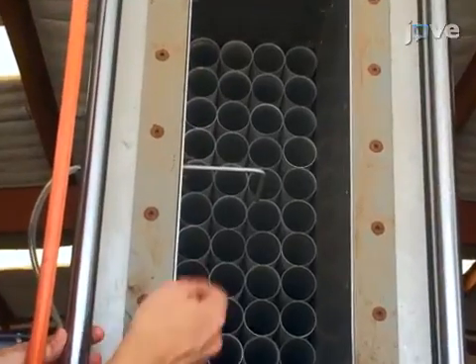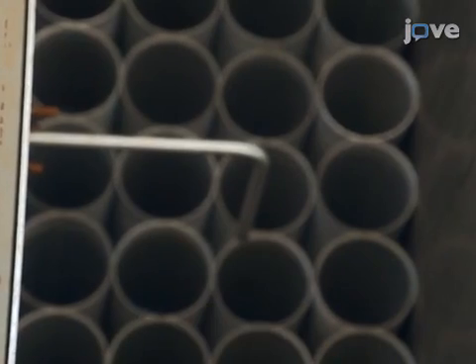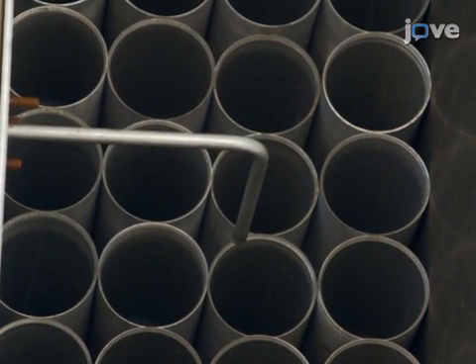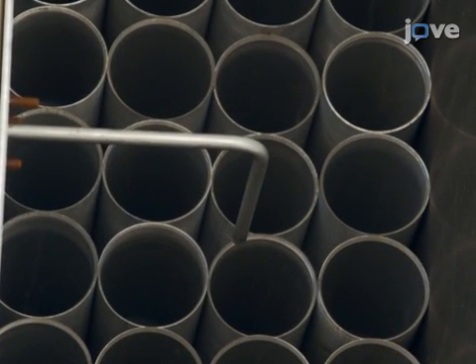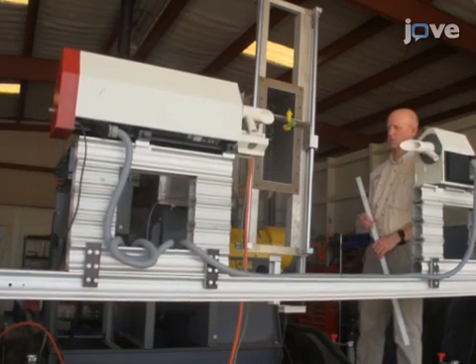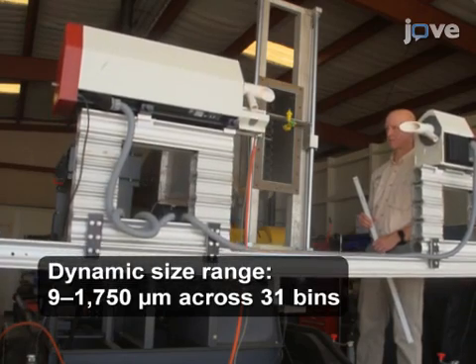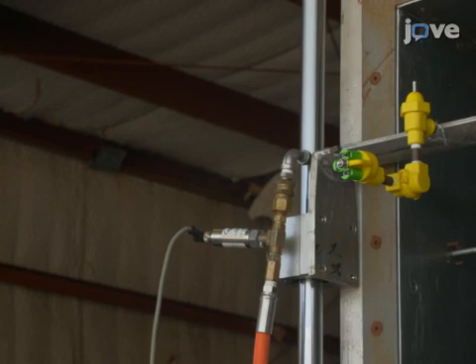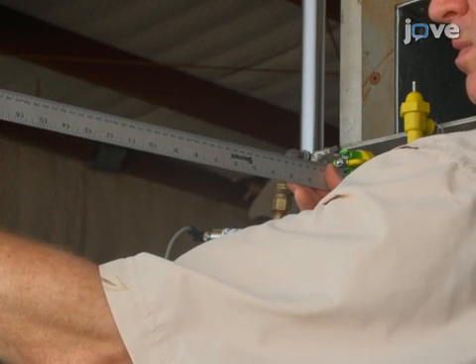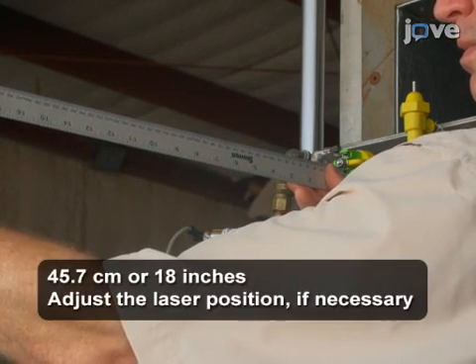Place an electronic pressure gauge just upstream of the nozzle. For this setup, a pitot tube allows for measurement of the wind speed. In front of the nozzle body, have a properly aligned and configured laser diffraction system. For these measurements, confirm that the distance between the nozzle outlet and the measurement zone is 45.7 centimeters.